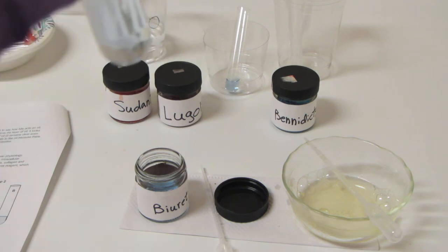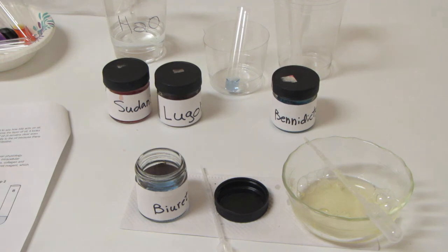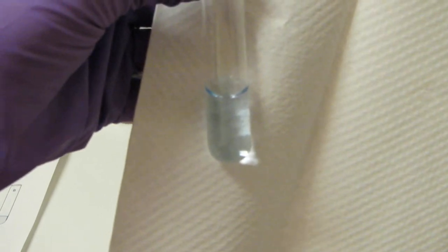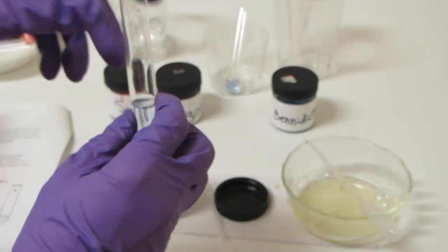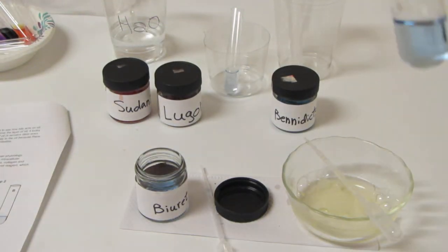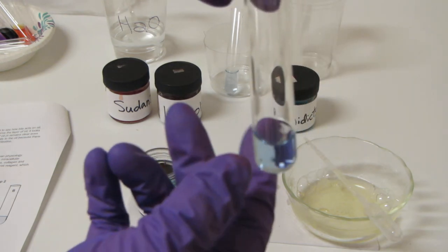But that's pretty much all that's happening. Now when you're dealing with a dye which is a very light color, you can make it easier to see color changes by putting it against a white background. So if I use this white paper towel, you can see that it's still light blue. It got a little diluted. But now let's see what happens if we take a new tube of Biuret Solution. Here I've got a nice fresh one. Let's see what happens if we mix it with some protein.